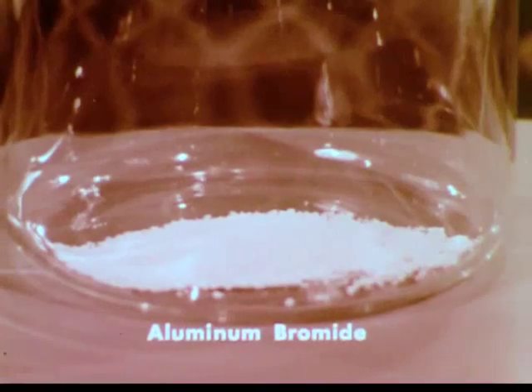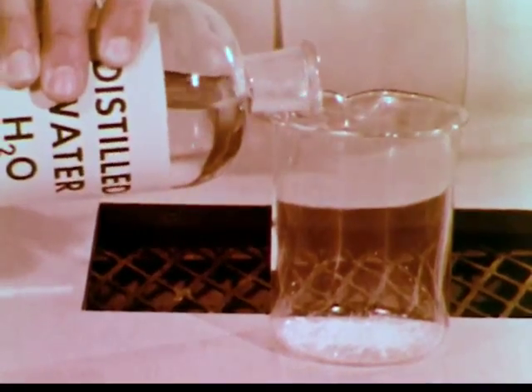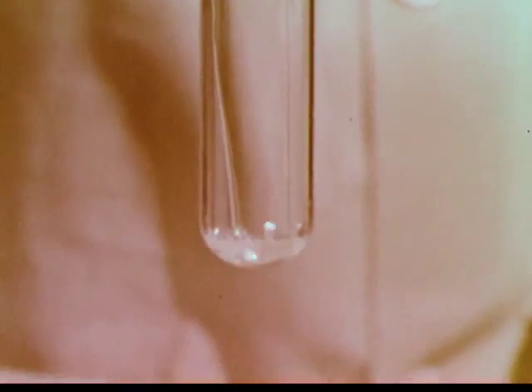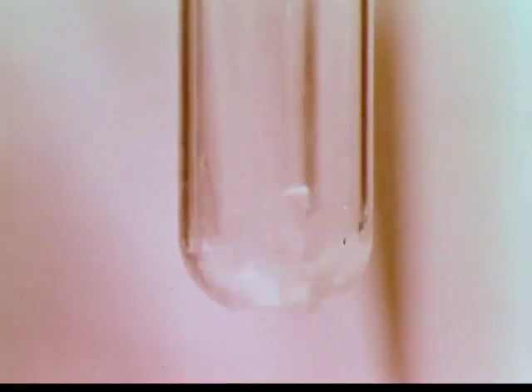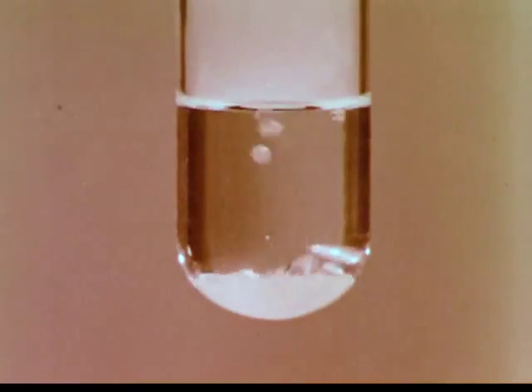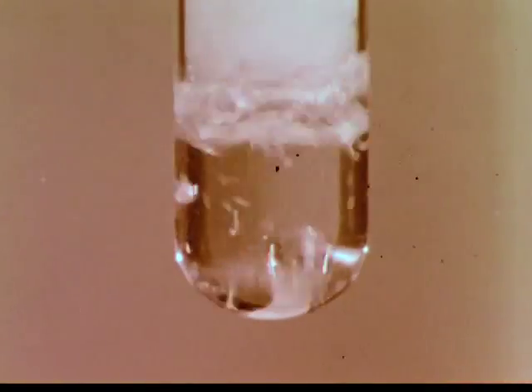Is this bromine compound soluble in water? When water is added, a vigorous reaction occurs as the aluminum bromide dissolves. Here's the purified product from the phosphorus and bromine reaction. Phosphorus tribromide is a liquid. Again, we'll add water. The reaction starts slowly, but soon gives off so much heat that bubbles of steam are formed. The reaction continues until all the phosphorus tribromide has dissolved.